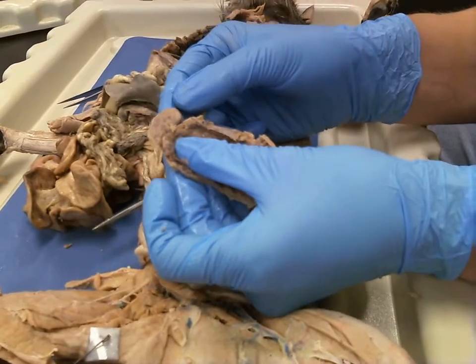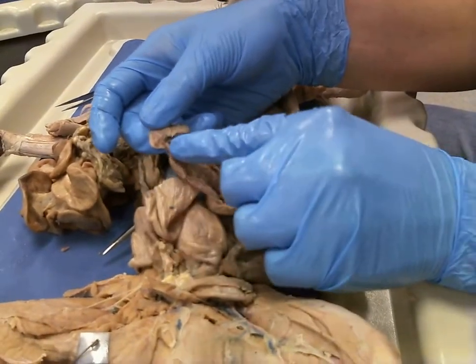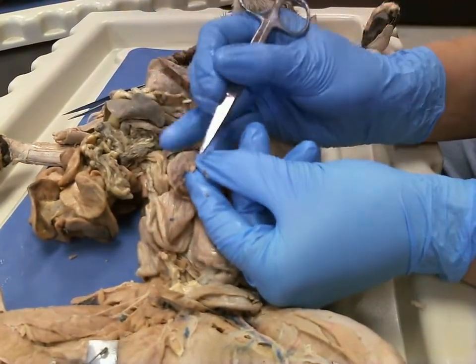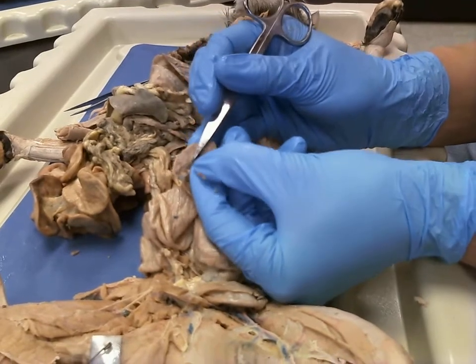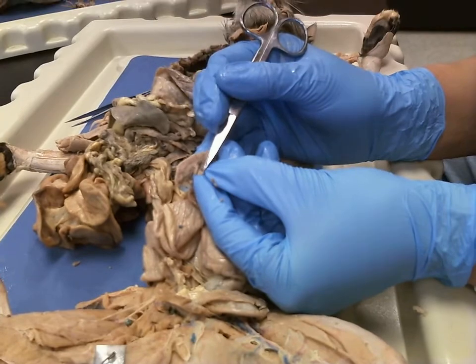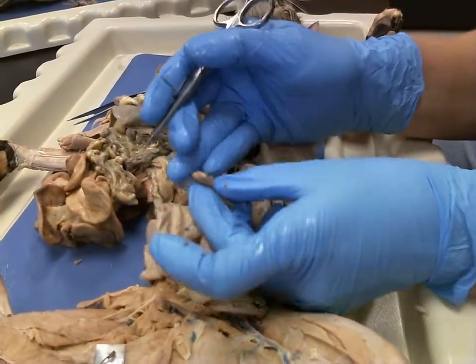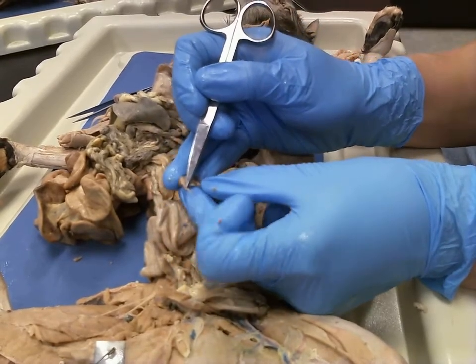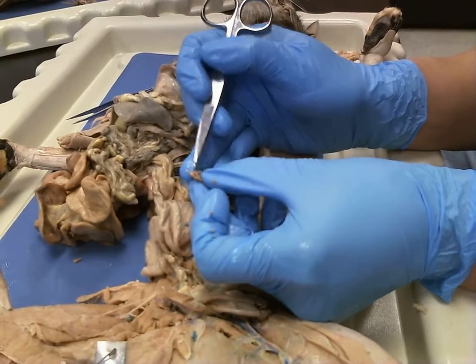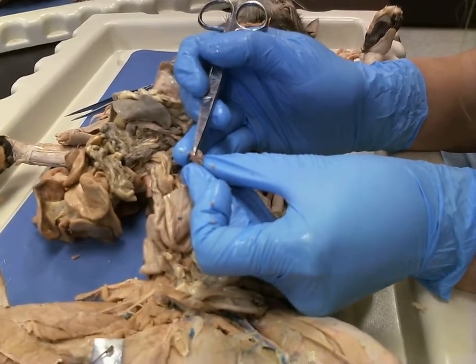All right. So on this fetus, you're going to notice you've got your umbilical cord right there. On this fetus, you're also going to notice you have your arm or forelimb, you have your paw or hand, and you have your fingers or toes since this is a kitty. Down here, you're going to flip this up, and you're going to see you've got your tail. You're going to see you have your legs. You can flip your tail up, and you can actually see your external genitalia.